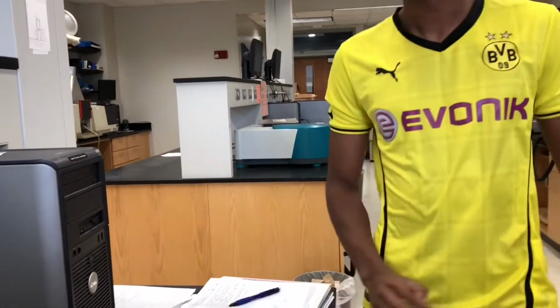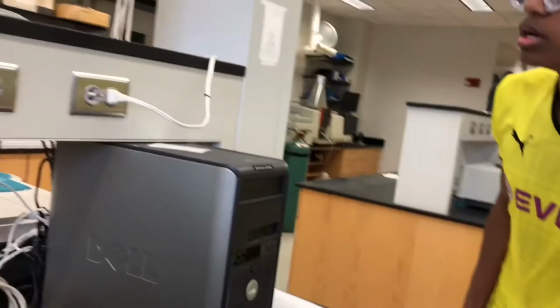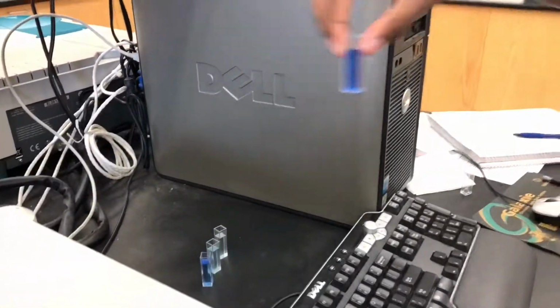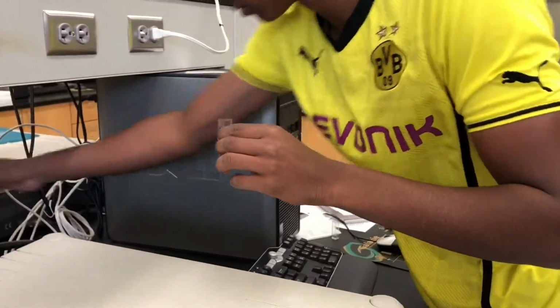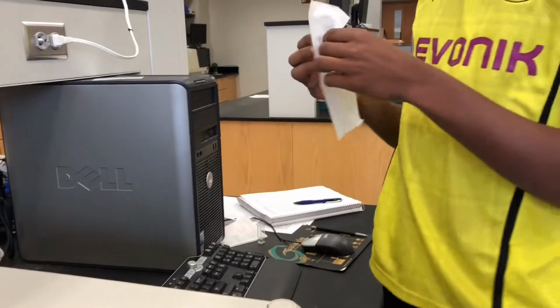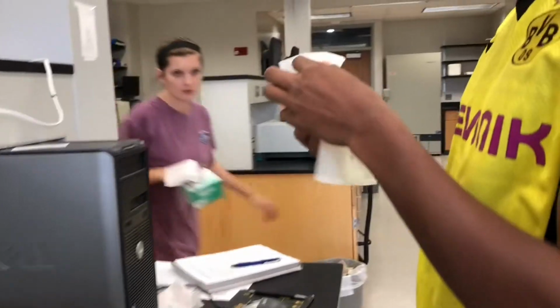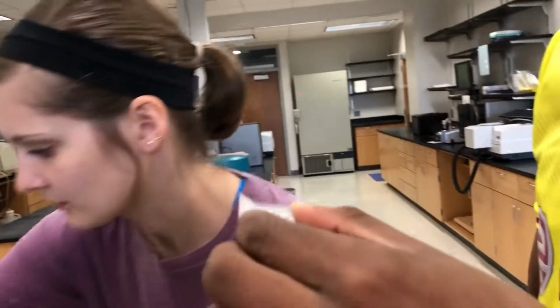For this lab, the solutions have to be diluted and absorbed at different wavelengths so enough energy is received by the detector and the different qualities in molecules can be properly observed. Another reason why you have to scan all wavelengths is so you can properly observe lambda max, which refers to the wavelength along the absorption spectrum where a substance has its strongest photon absorption, and compare it to that of the unknown.